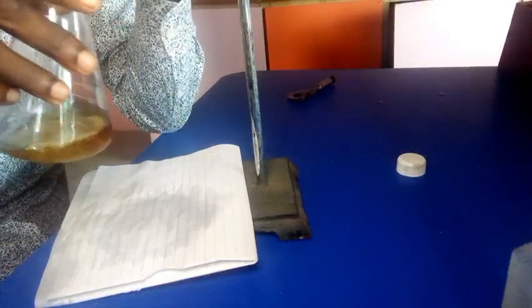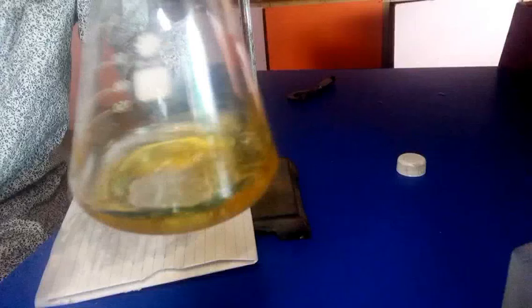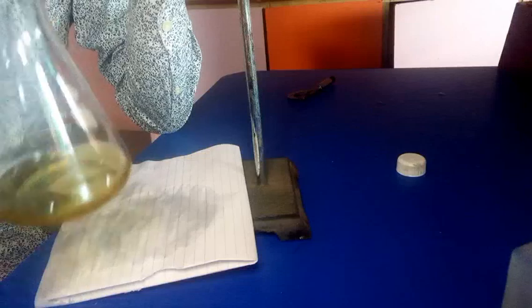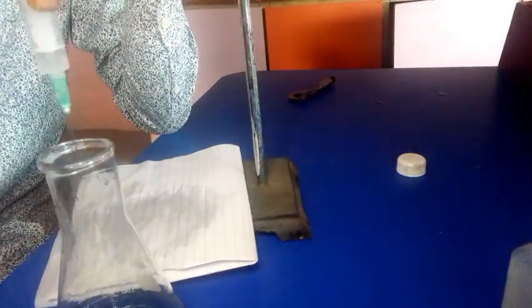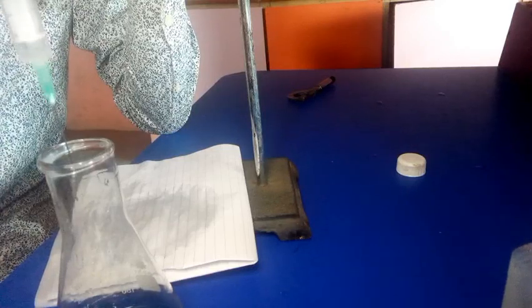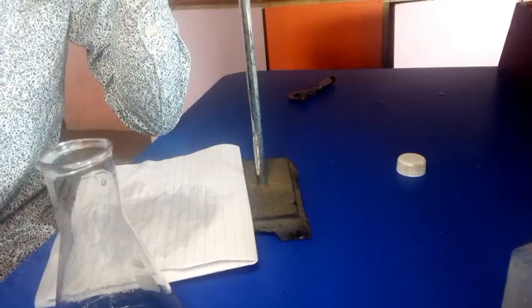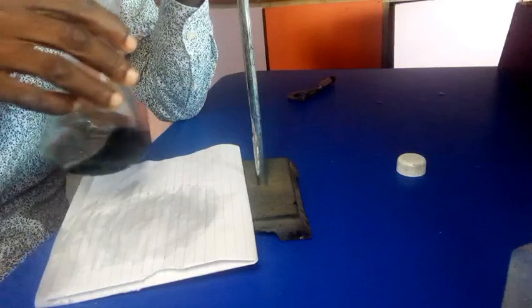That's how it goes. So I think I've seen the yellow color now. So I think mine is too quick, but you might not observe that while performing yours anyway. So now let's add the starch at this point. I'm adding my starch with a syringe, but I'm being careful to add just enough drops for it to be visible. So then I go ahead with the experiment. So now let's see.